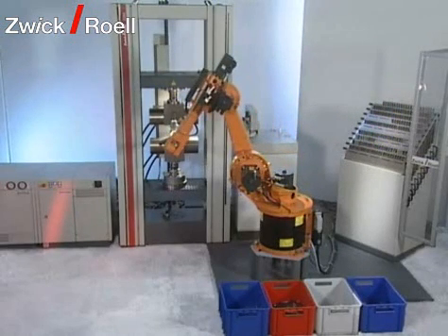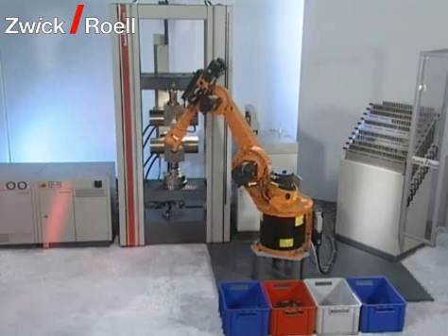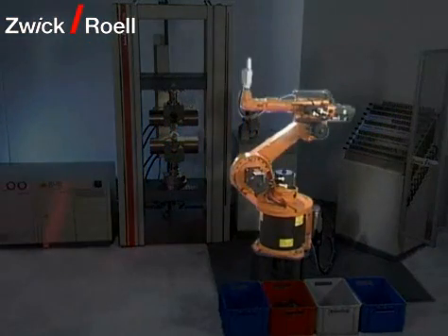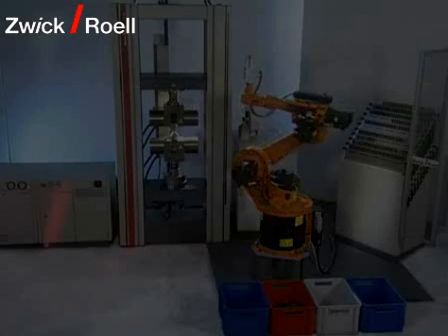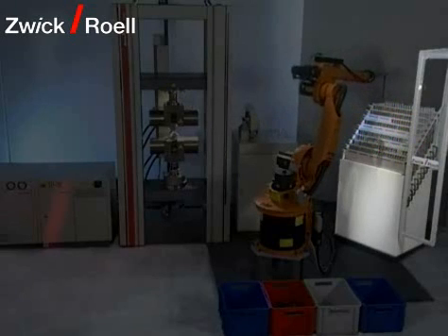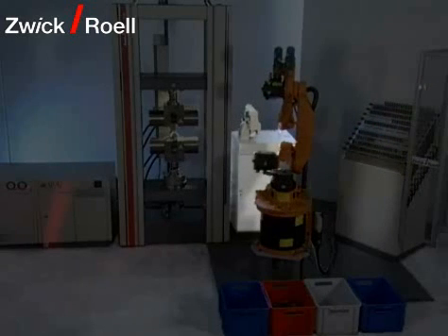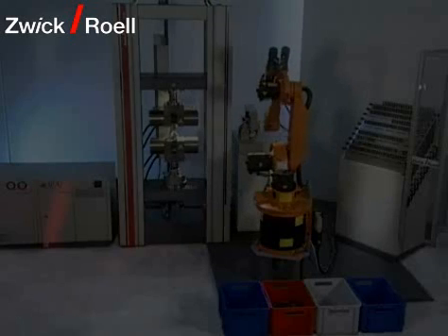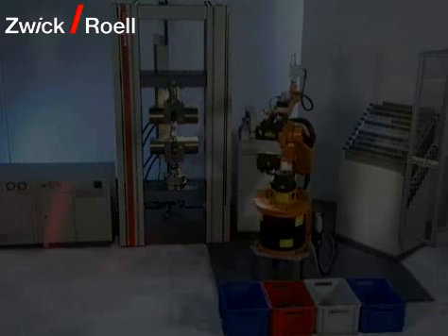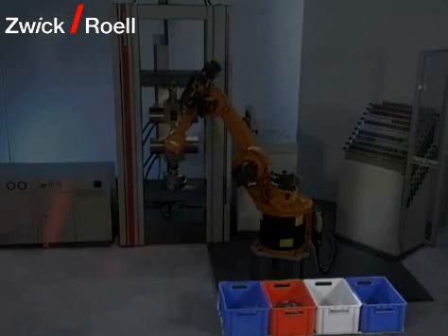The automatic test system in polar construction is designed for the testing of metals or plastics. The test system consists of the following individual components: the robot to transport the specimens to the different measurement stations; the variable specimen magazine with the capacity to hold up to 250 dumbbell specimens; the cross section measuring device for the determination of specimen width and specimen thickness; the materials testing machine with specimen grips plus extensometers for the performance of tensile tests; and the specimen removal containers to dispose of tested specimens.